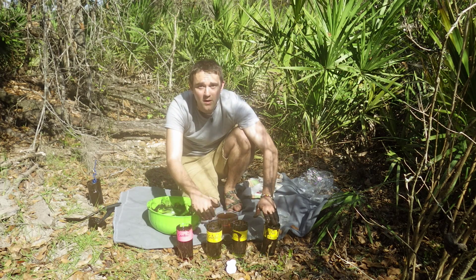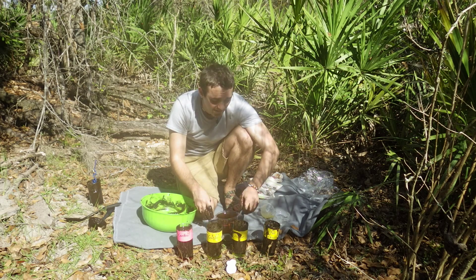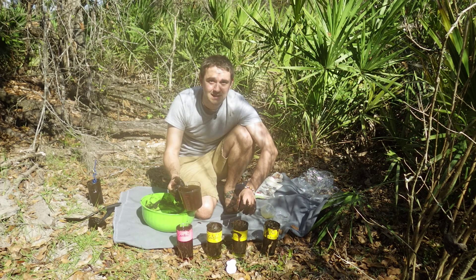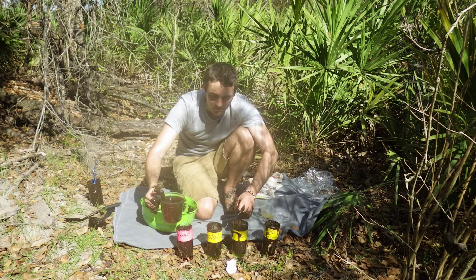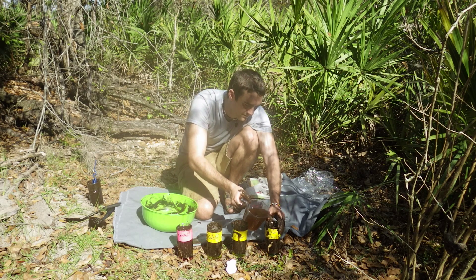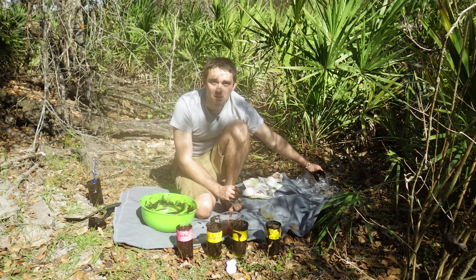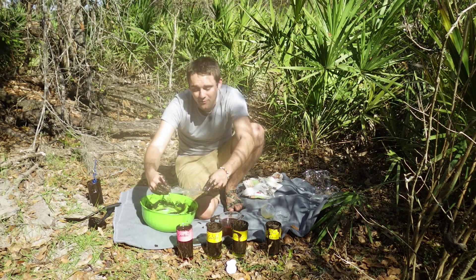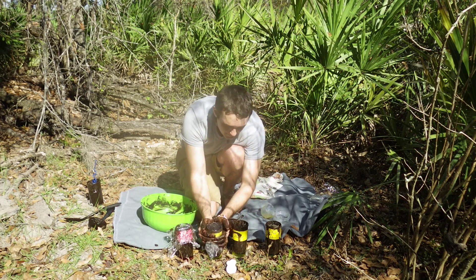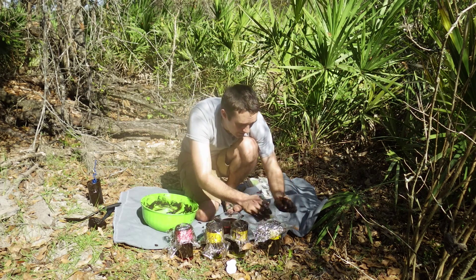Now I have the four Winogradsky columns with the mud. The last ingredient: on top you want about a quarter inch to half an inch of source water. It adds the extra microbes and also helps keep the mud moist so it actually grows the microbial bacterial communities. After adding the source water, we need to put on a top so the water does not evaporate off the columns. This is simply done with saran wrap and a rubber band — on each I'll add the saran wrap, and then after the saran wrap is in place, I'll add the rubber band.